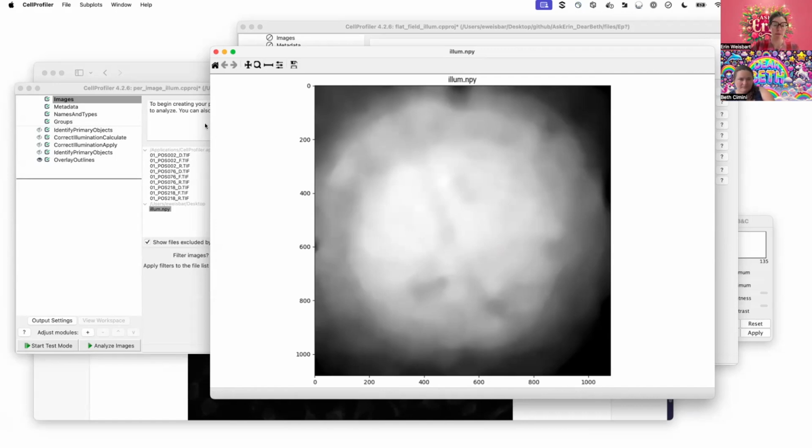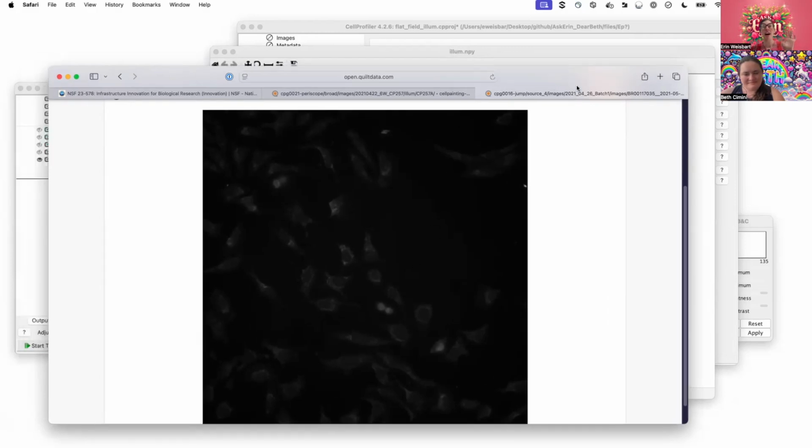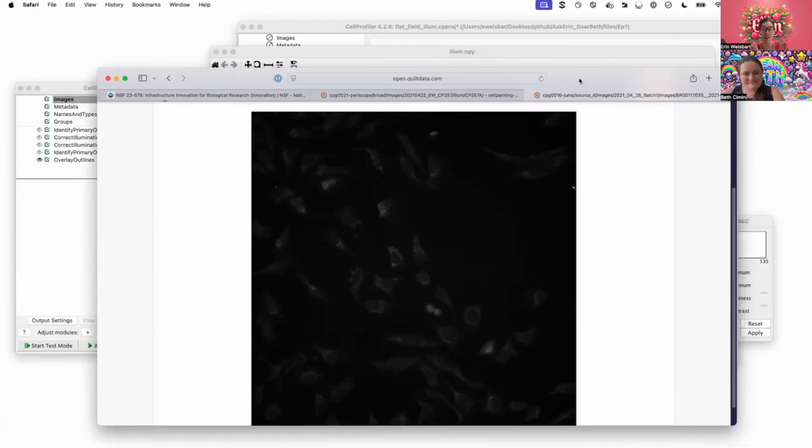For example, here I'm just using this online browser to pull up this image, and this is uncorrected, but by eye, no, I can't see that there's a vignette there in the illumination. If I were to download this and open it in Fiji and scale it, I could definitely, but again, depending on how you're viewing it, you may not see the difference. But mathematically, it is an important correction. So that's the big picture behind flat field.